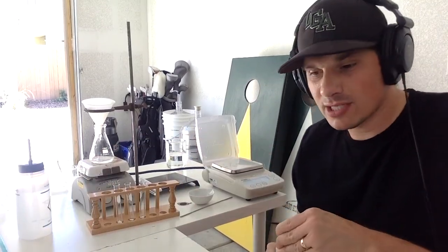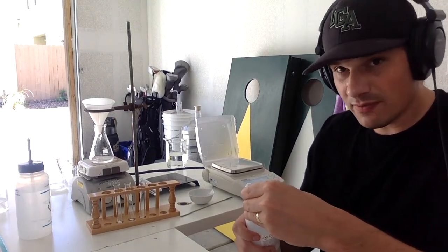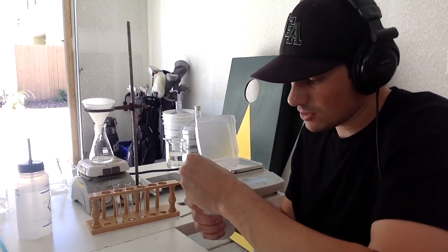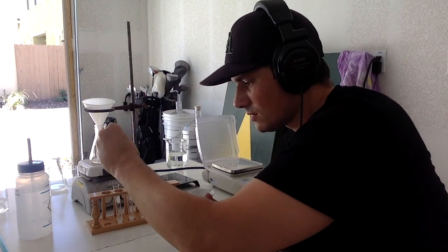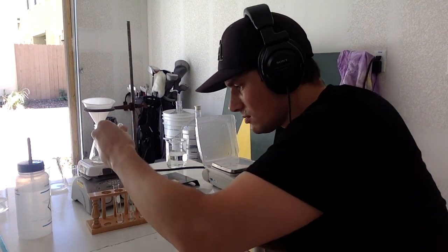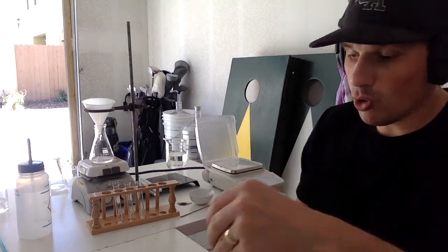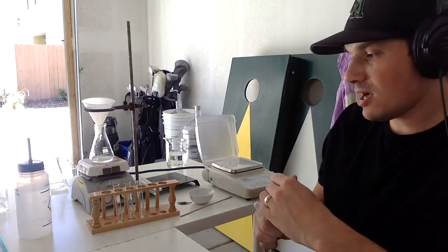So, iron test. First things first, we dissolve this in about 2 milliliters of 50% ethanol. That ethanol is going to dissolve it and make the reaction with iron more significant, okay? So let's put about 2 mils in. Now, we're only going to do a couple drops of the iron. You don't need that much for it to react. And then we'll make some observations on what we're actually seeing and what it actually means.